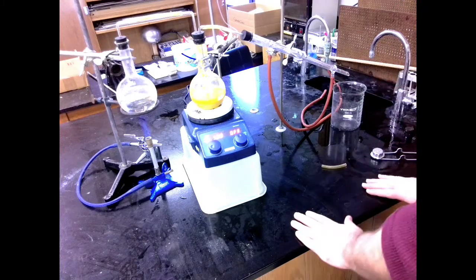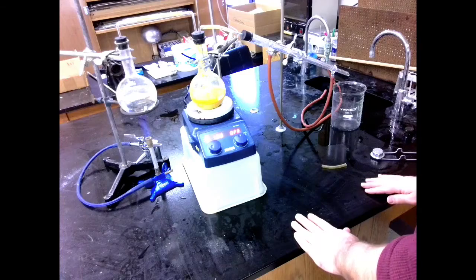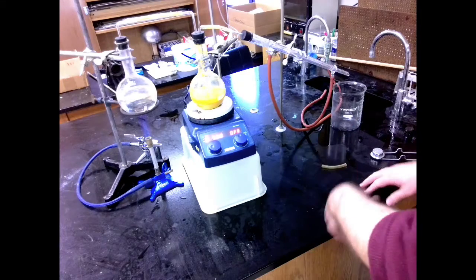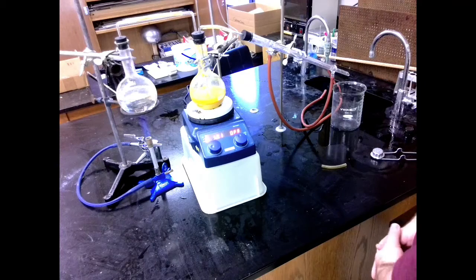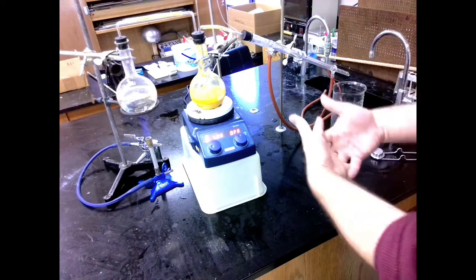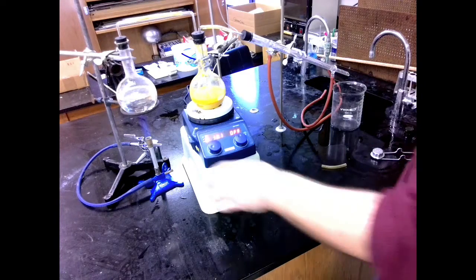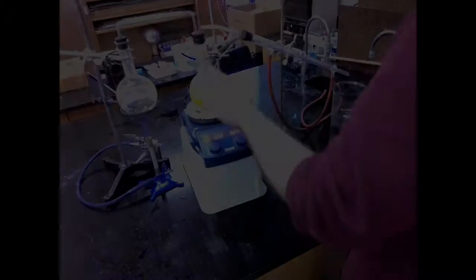Otherwise, mostly this setup will take care of itself. So while you're waiting on it, you should be looking at other homework. You should be reviewing your IUPAC naming structures and letting this run its course. Just keeping an eye on this water level and how vigorously it's boiling. Just keep going.